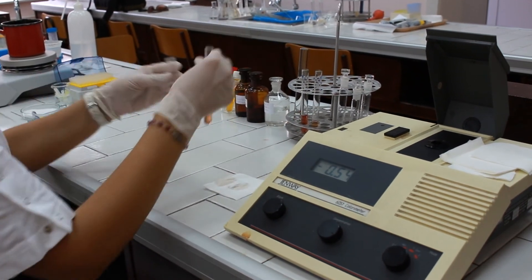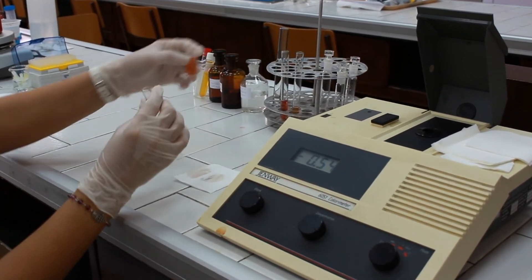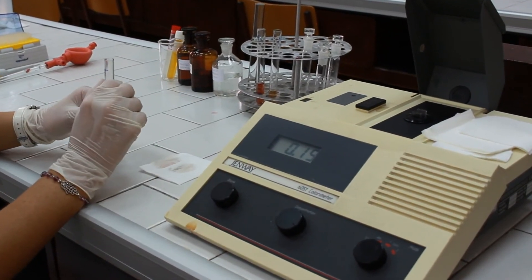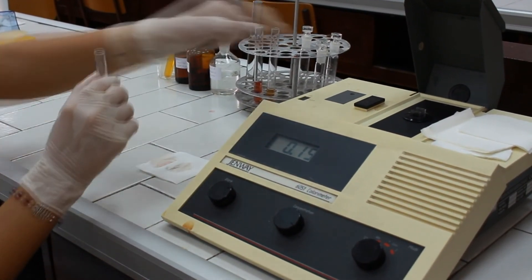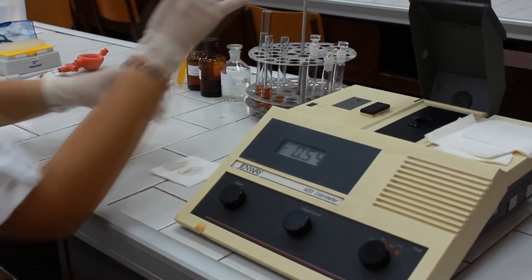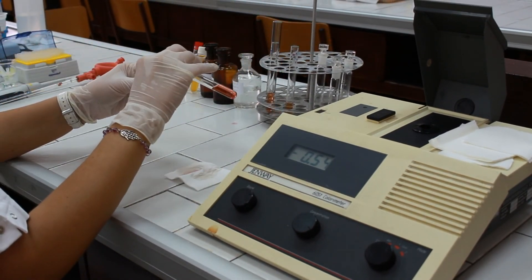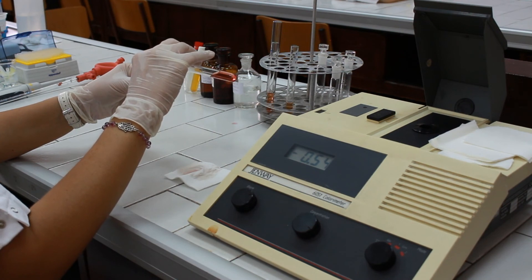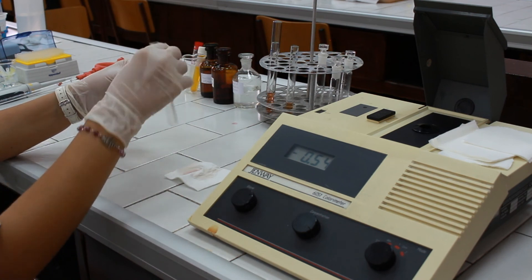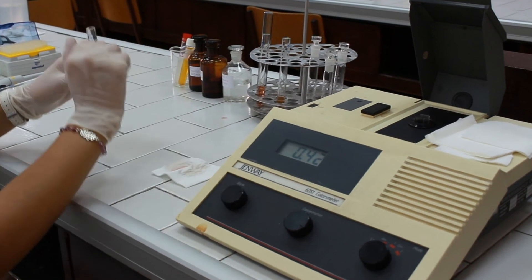Take the cuvette and pour the test solution, then read the absorbance. Next, take the standard solution and read its absorbance.